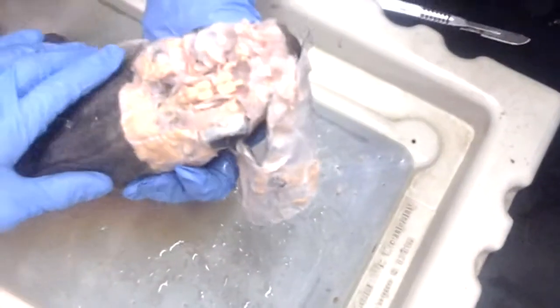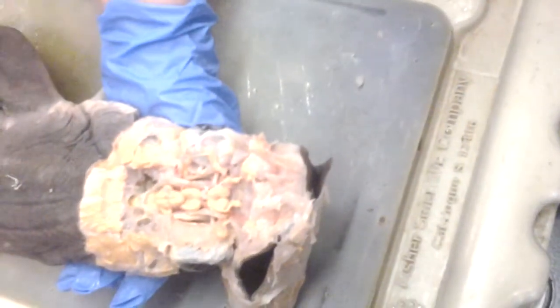See this here and here? These are all eye muscles. So this is the superior oblique right here. Now, what's this one in the back? The inferior oblique? No. Lateral? No, medial? It's another superior. Inferior rectus? No, that's not it. Superior rectus. You said it. Yeah, you got it. So it's the superior rectus.